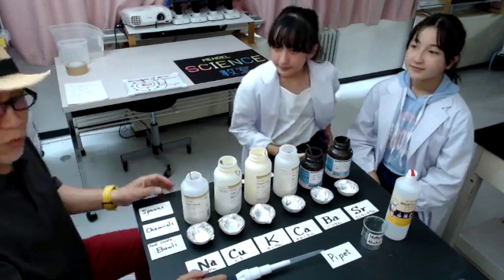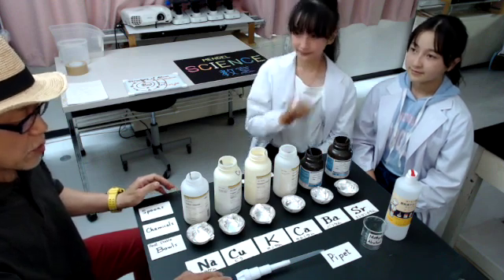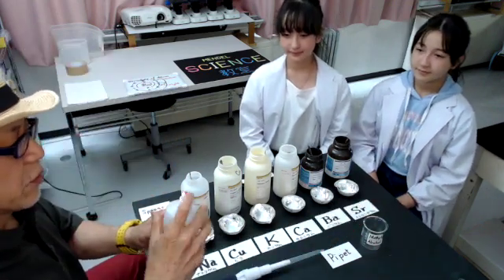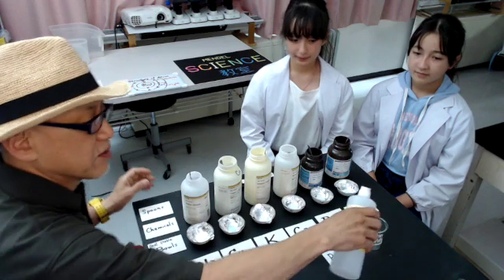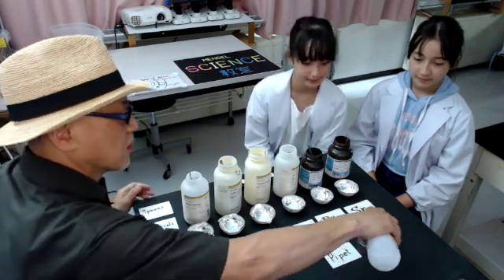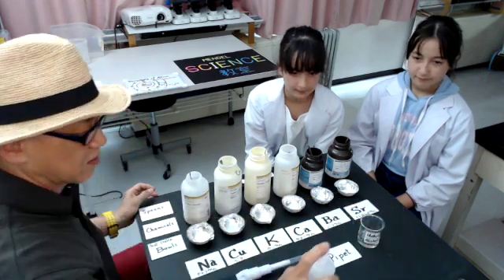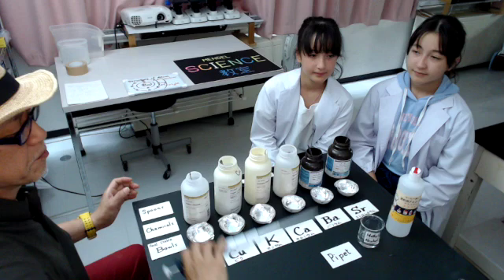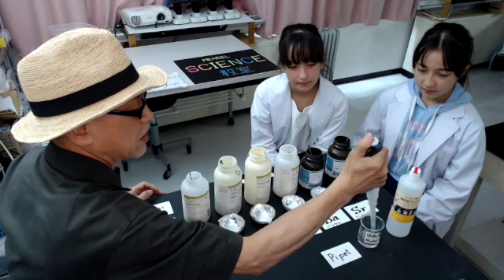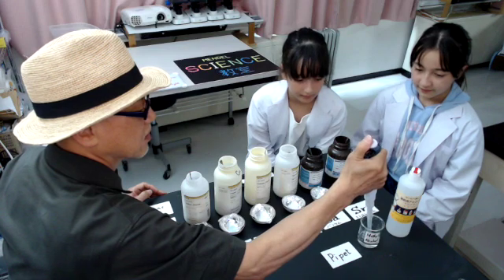Because flame reaction can be occurred in the flame, so we should add fuels. Today I will use methanol, methyl alcohol. Using a pipette, 3ml each of methanol should be added to each chemical.